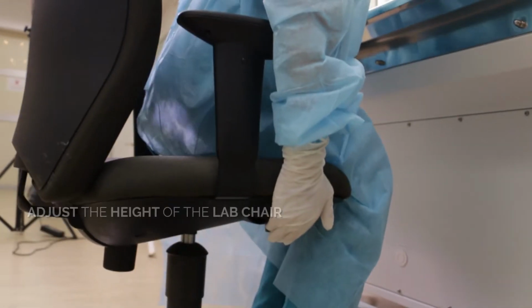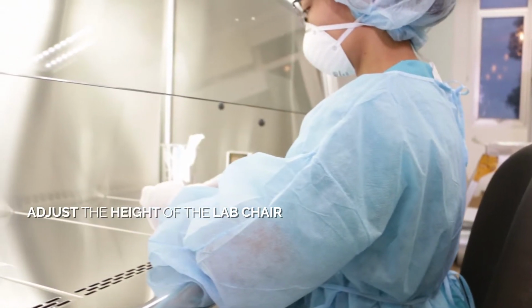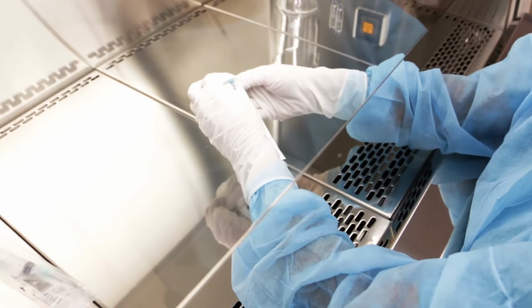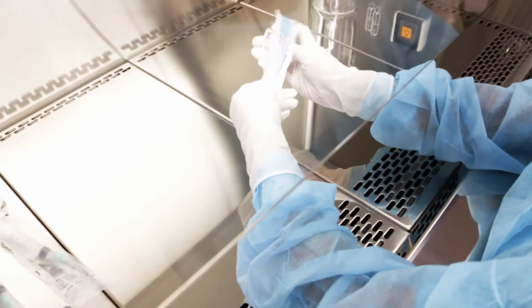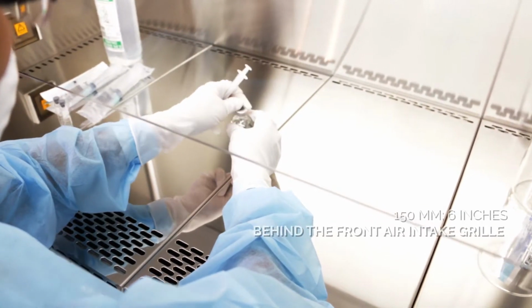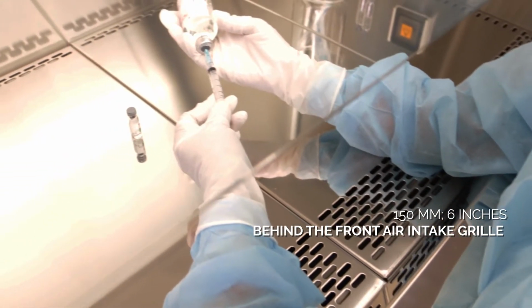Adjust the height of the lab chair so that the shoulder is approximately level with the front sliding sash to give you better visibility of the work zone and ensure that your face is protected by the front sash. Working with the Cytoculture Cytotoxic Safety Cabinet. Work as far inside the cabinet as possible, at least 150 millimeters, 6 inches, behind the front air intake grill.